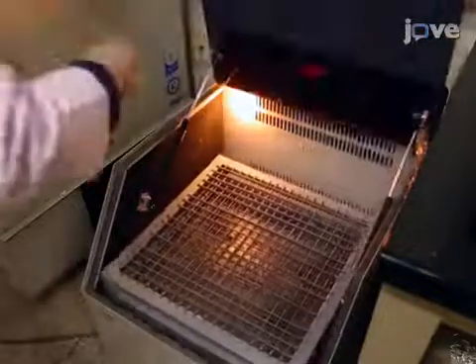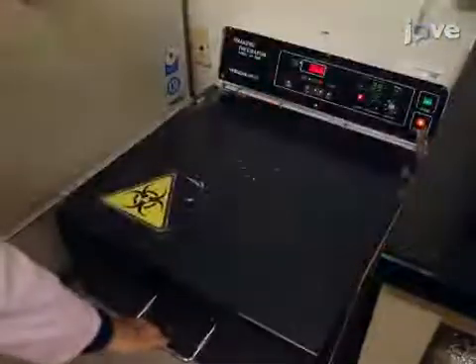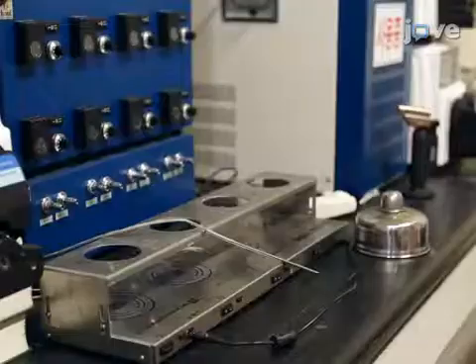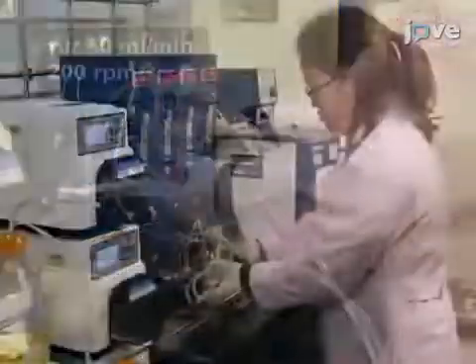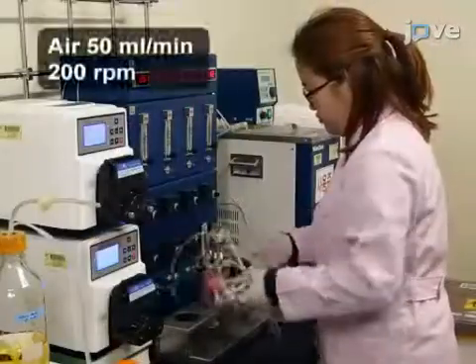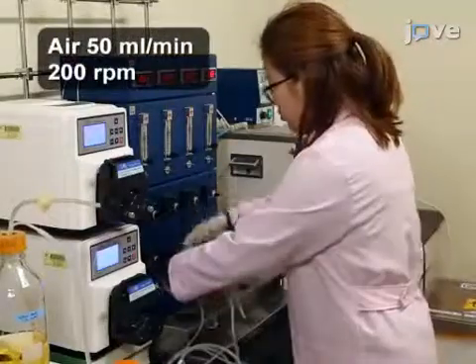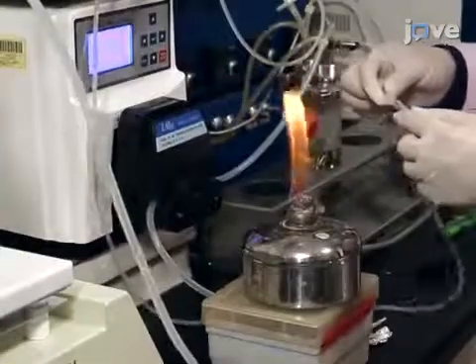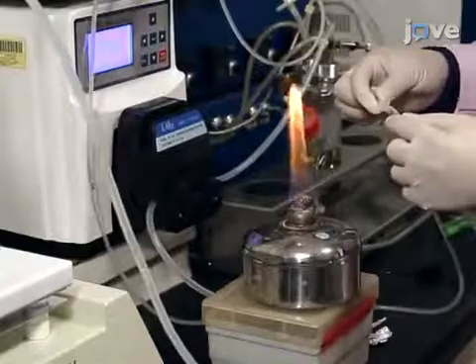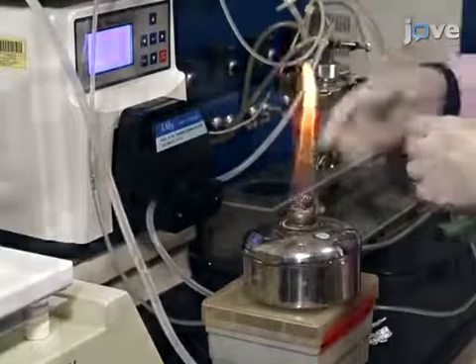Incubate the test tube in a shaking incubator for 12 hours at 37 degrees Celsius and 220 rpm. Then incubate the chemostat jar, providing for aeration and agitation, at 37 degrees Celsius for six hours.